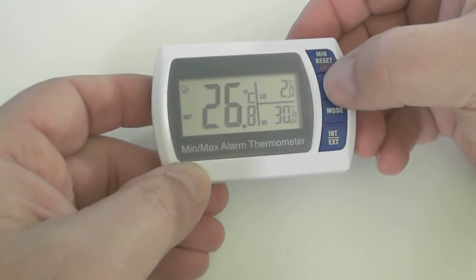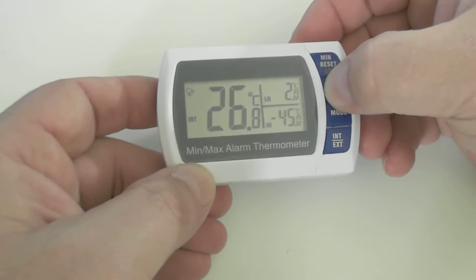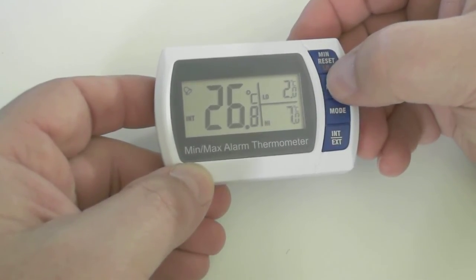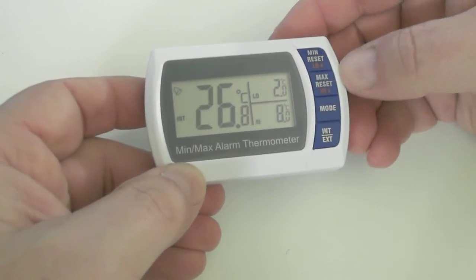There's our low — two degrees. Now let's do the same for the high. We'll depress that and we're going to go to eight. So we'll go up past the 70 degrees Celsius and cycle back around. Depressing it once will give you one degree increments. Your unit's now set.